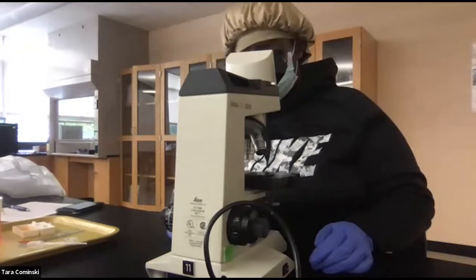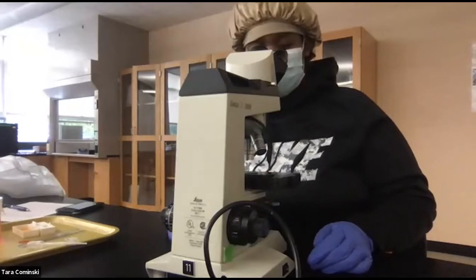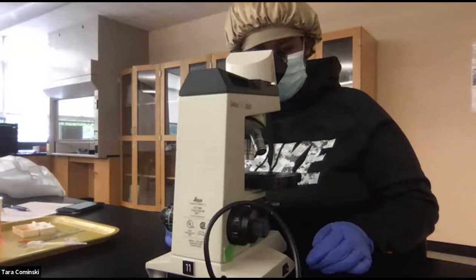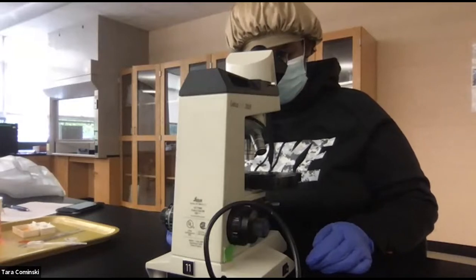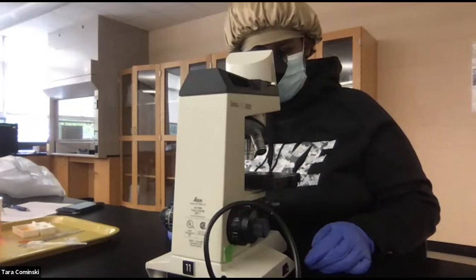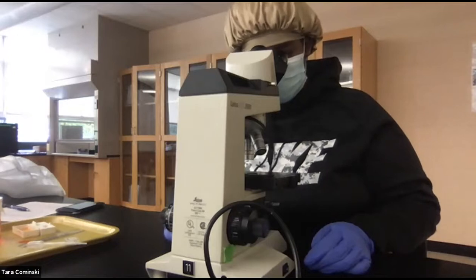Now to move this around, to get it in the middle, you move it this way. Yeah, you got it, Erica. Turn your light on, see if you need to. Oh, you're not plugged in. Where'd your plug go? That's interesting.